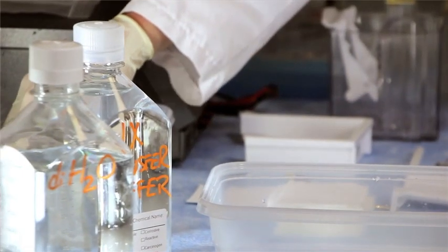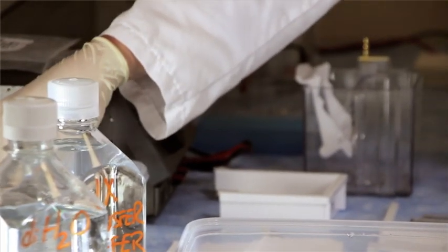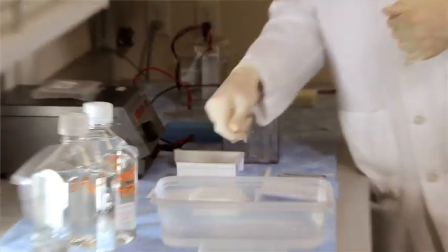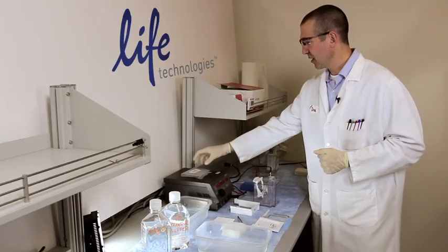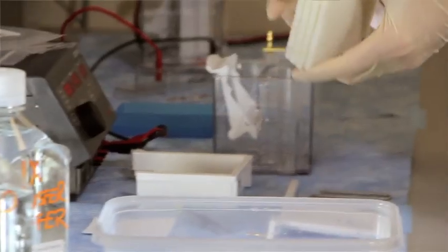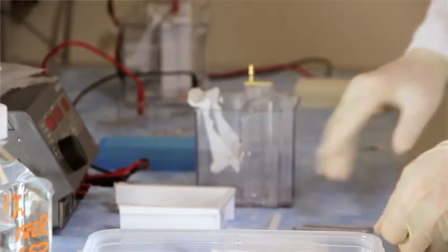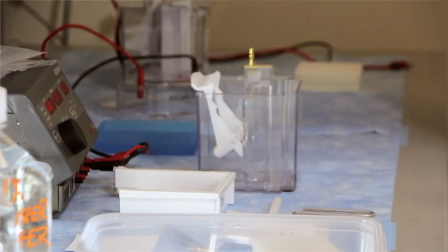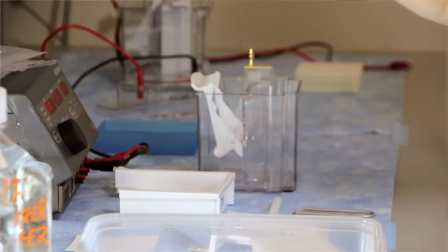We've got our NuPAGE gel that we've already run our protein samples on. We've got our PVDF filter sandwich kit. We've got our sponges. We've got our blot module, our power supply, and a timer.